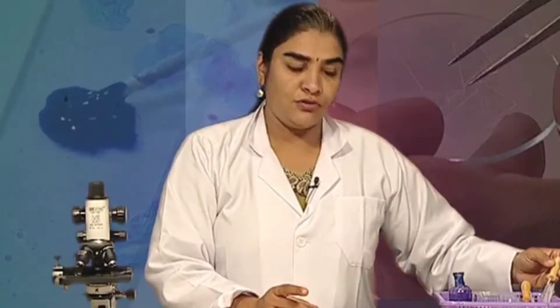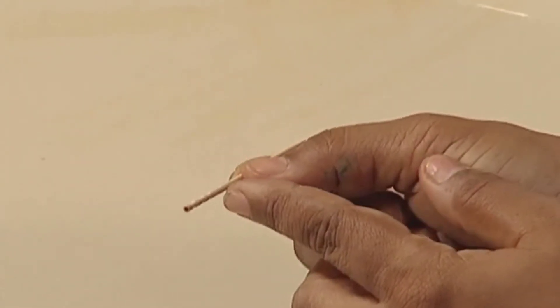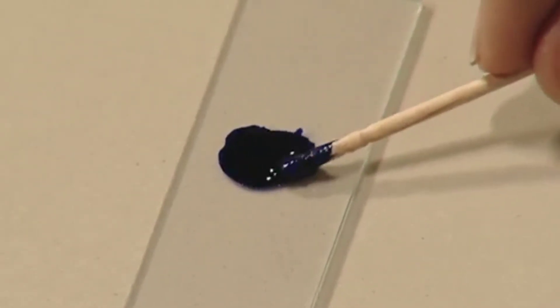Make sure that you use separate droppers for taking water and stain, and once you have used the stain, you cover the bottle. Now, take a clean toothpick which has not been used at all. Use the blunt end of the toothpick to scrape the inner lining of your cheek very gently, and then transfer this material onto the slide where you have taken the stain, spreading the material throughout.